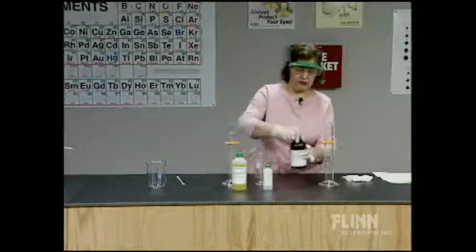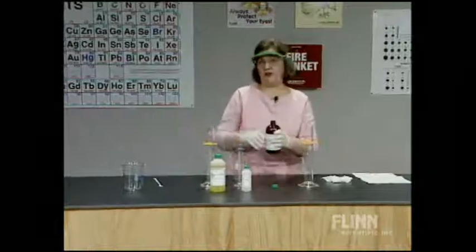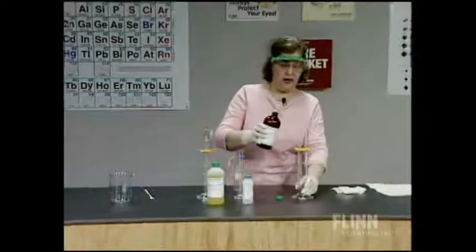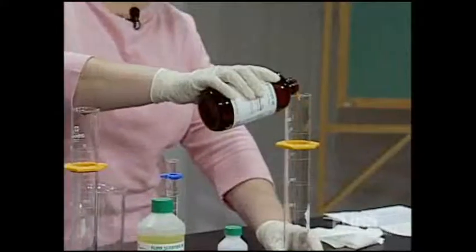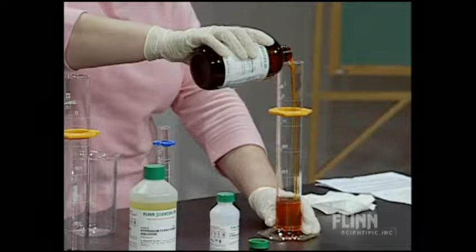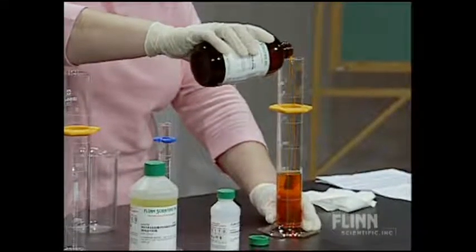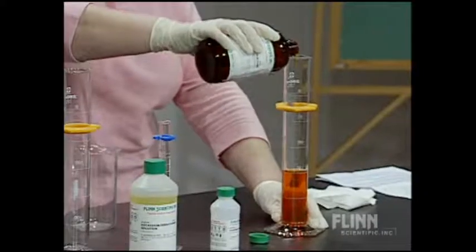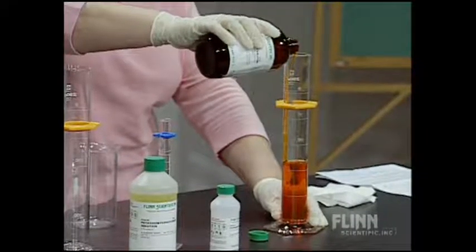The first solution I want to measure and pour is what we call our energetic light solution. It's a mixture, and I want about 140 milliliters of that. You can see that it's an orange, slightly viscous liquid.